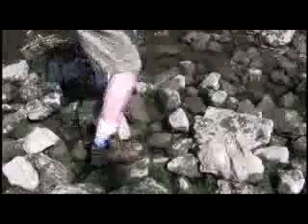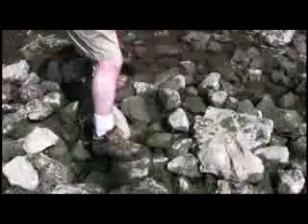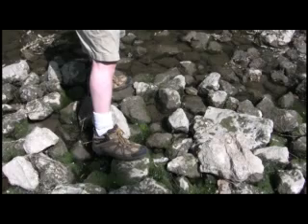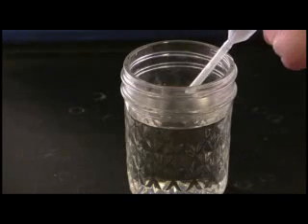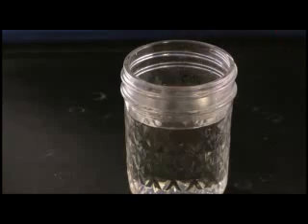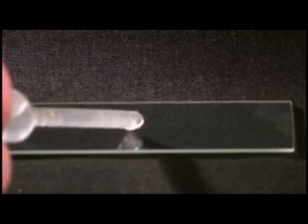Part A. If you are near a pond, river, or ocean, collect some of this water into a jar or a ziplock bag. Take your samples home. Use a pipette, eyedropper, or straw to pick up some pond water from the top of the sample, and place a small water drop onto the microscope slide.